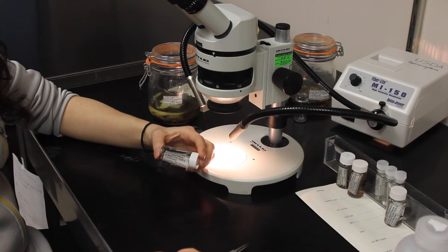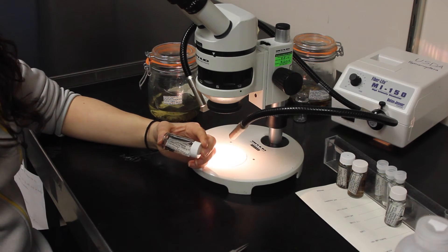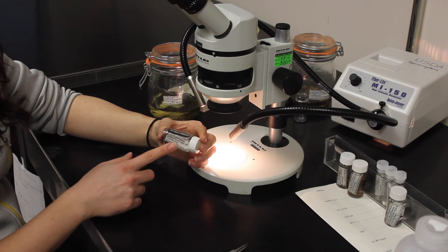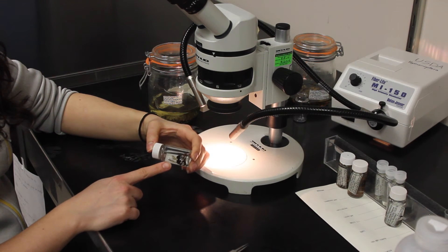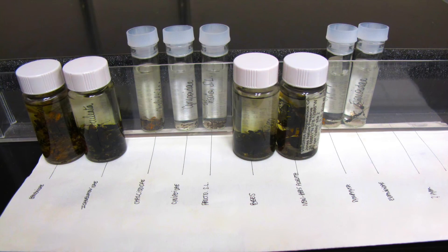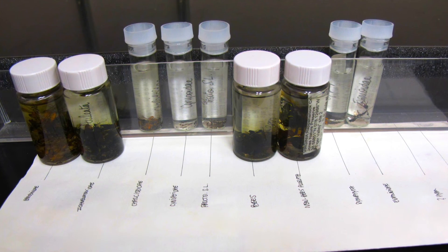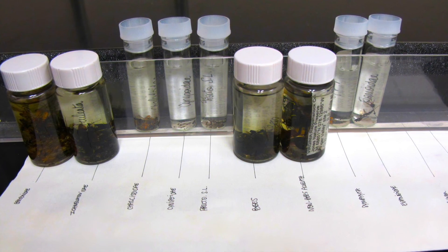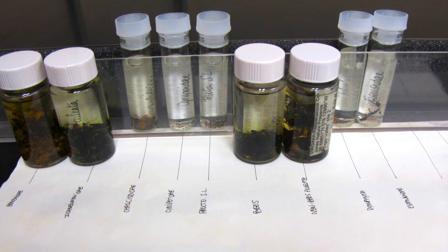I have also printed, filled in, cut and inserted vial labels that have the location, date range and unique identification number on the front of the label, while the back of the label contains the family that the vial is including. Now you have completed your sorting. You should dispose of all waste chemicals in the appropriate waste containers designated by the lab protocol. Store your sorted samples in an organized container in a designated location by your supervisor. Good luck and happy sorting.